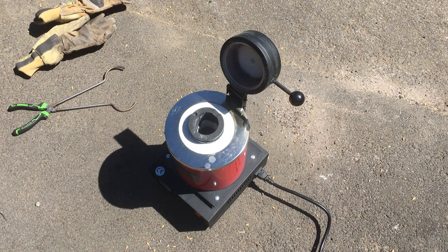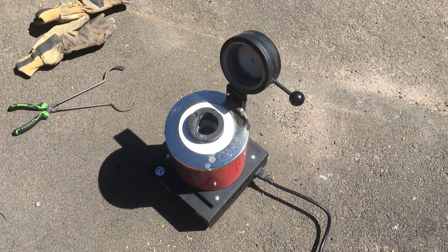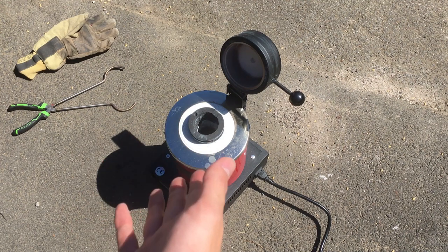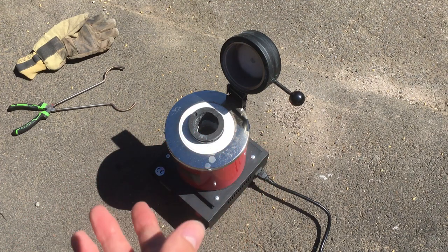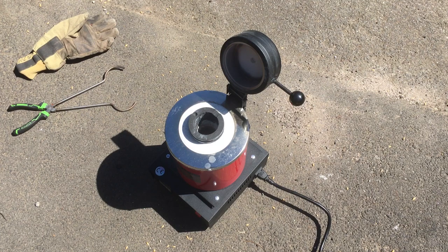I've already put in about half a battery's worth of the lithium-containing electrode materials and been heating it slowly up to a thousand degrees. We're at around 500 degrees right now and nothing has really happened — no smoke coming out, which is a good sign. What I expect to happen is for any solvents present in our battery materials to just evaporate off or burn away. Same for the plastics — they'll all burn away as well. I've tried my best to remove all of the plastic from the material we're putting in the furnace, but there will inevitably be a small amount.